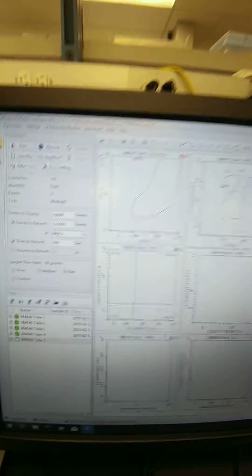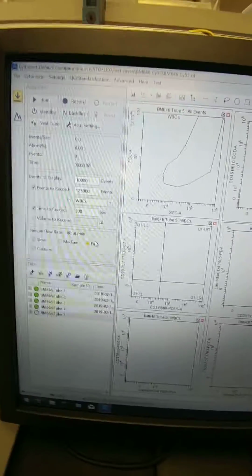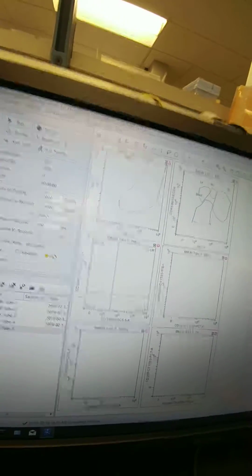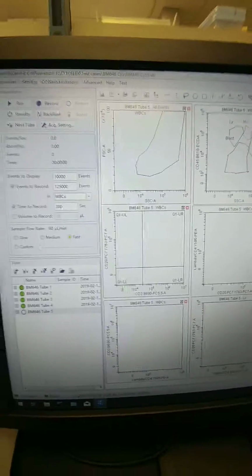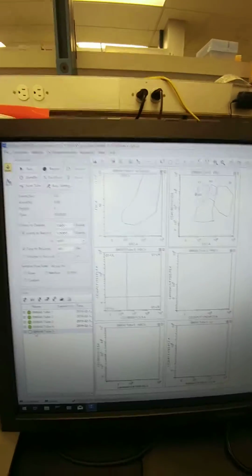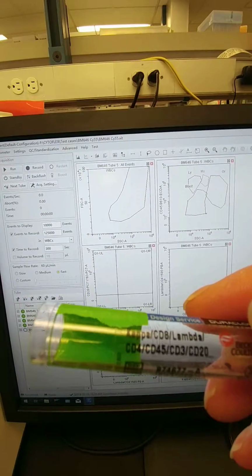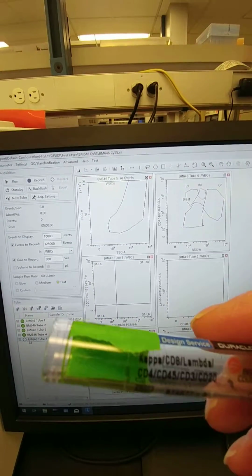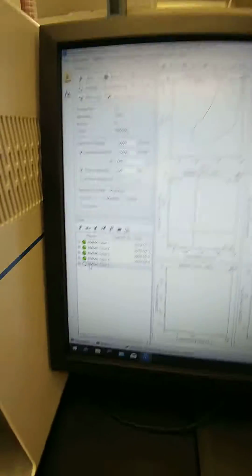Okay, so when we run this, we're going to now look and we're going to collect 5,000 to 10,000 events, and then we'll hit stop, and we'll increase another increment and collect 5,000 to 10,000 events, and we'll do that for maybe 3 different settings. Okay, so I have tube 1 here, and again, always important, if you're not sure which tube you have, if it doesn't say on the label, you can look on the tube here. And so this one does have up there the kappa 8, lambda 4, 45, 3, and 20. So make sure you're running the right tubes in the right order.